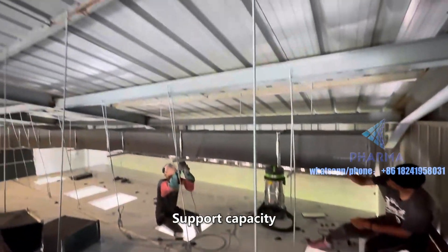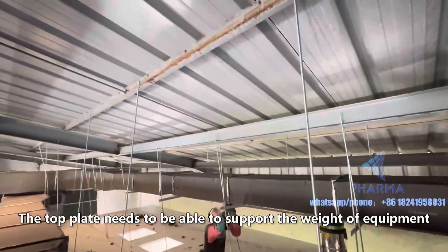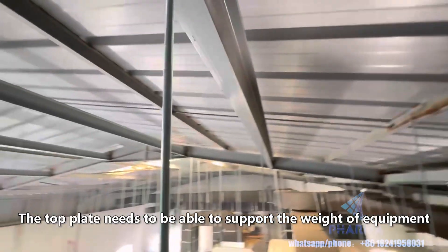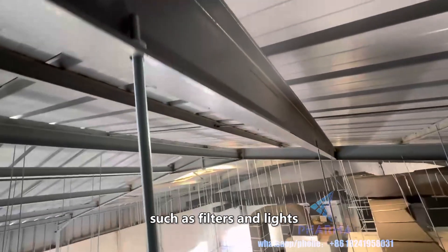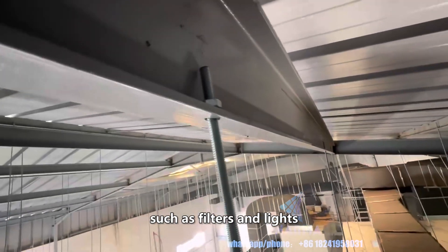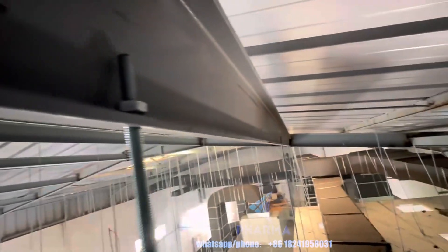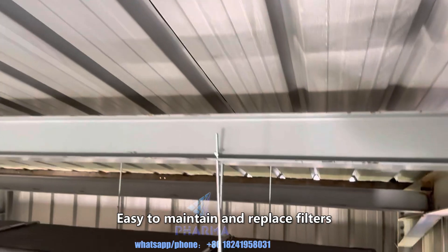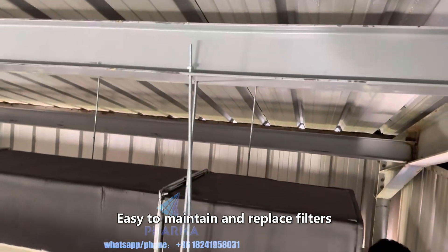Support capacity: the top plate needs to be able to support the weight of equipment such as filters and lights. Modular design: easy to maintain and replace filters.